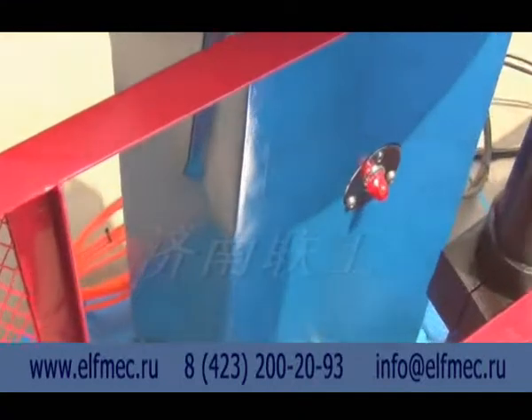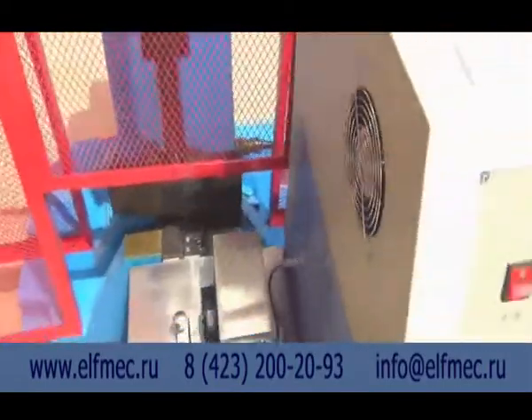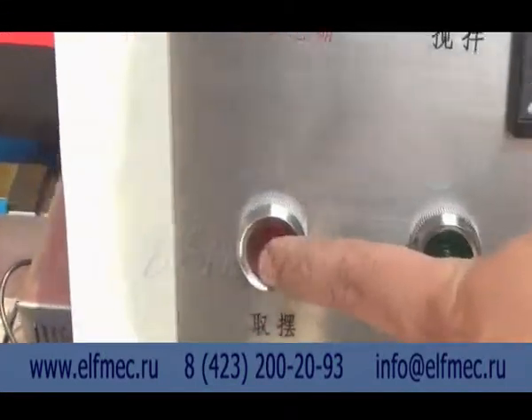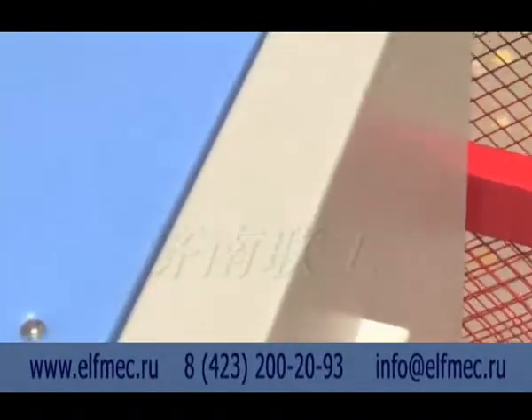Then shut off the power supply and adjust the phase sequence of the work power according to the pendulum rotation direction, so as to reach the requirement of correct use of the equipment. When the above operation is finished, test whether the corresponding mechanical action of each control button is correct.